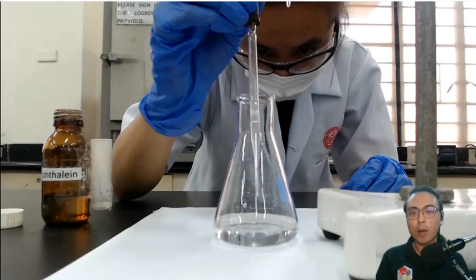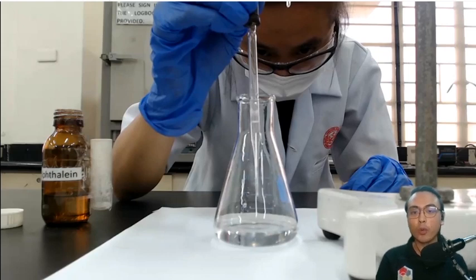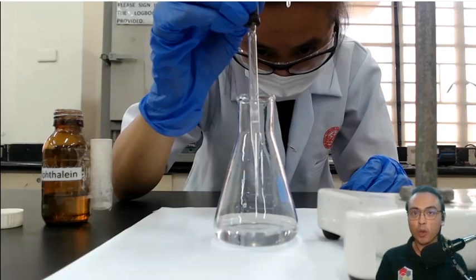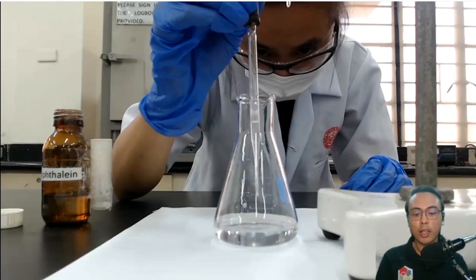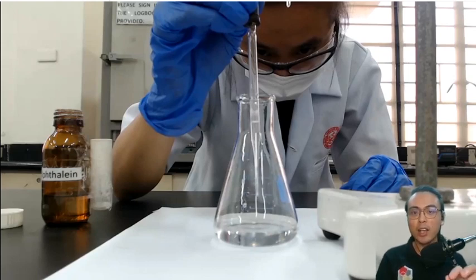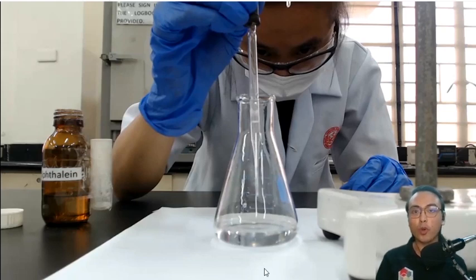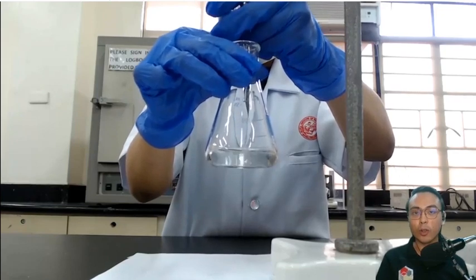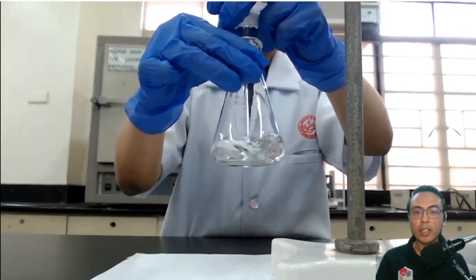As we add the titrant — sodium hydroxide, which is a base — the phenolphthalein will start changing its color to pink. It will only appear pink if there is a very tiny excess of sodium hydroxide. If the solution is bright pink, that means it is over-titrated because too much base has been added. For a perfect titration you are aiming for a light pink color, meaning only a very tiny amount of sodium hydroxide was added in excess of what was required to react with the acetic acid.